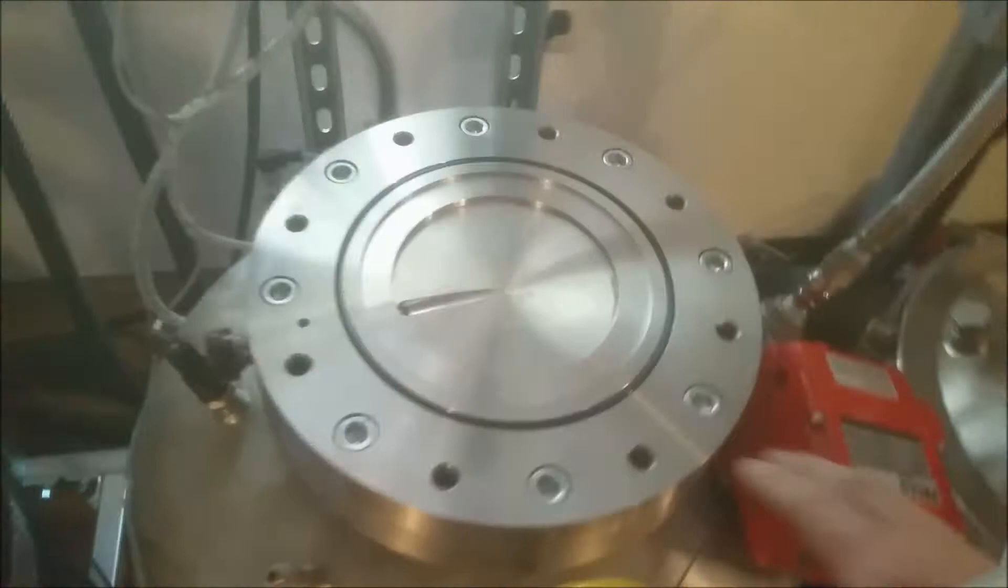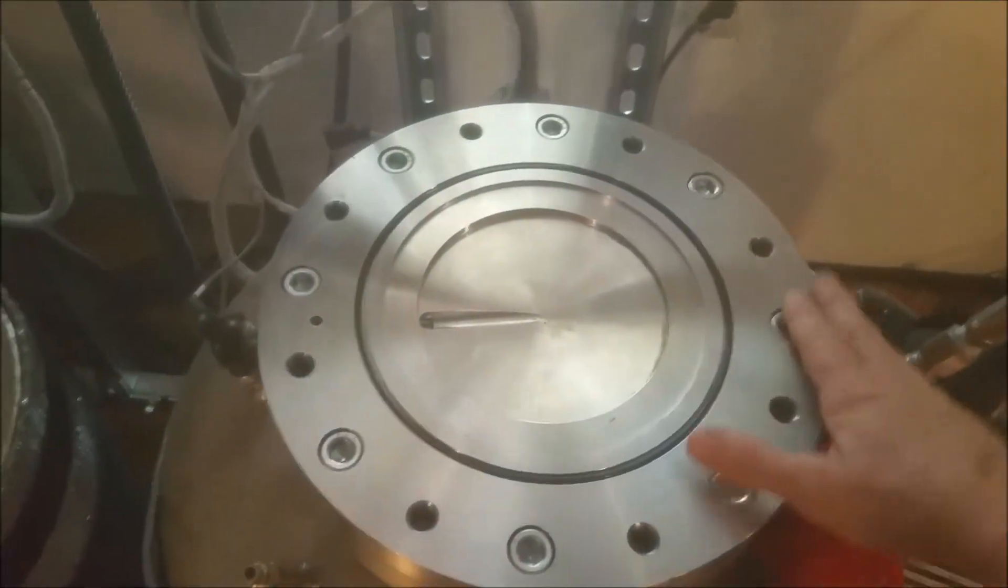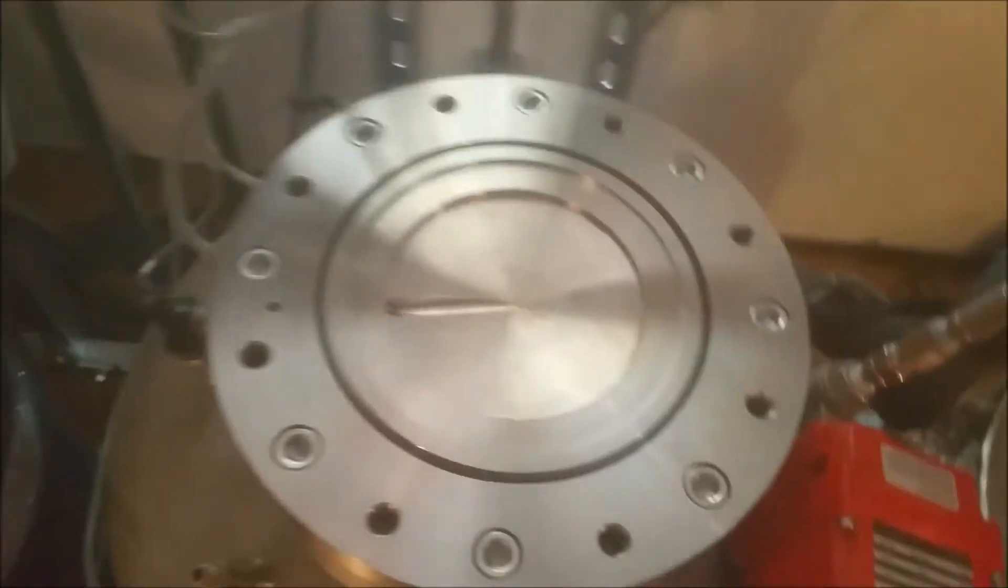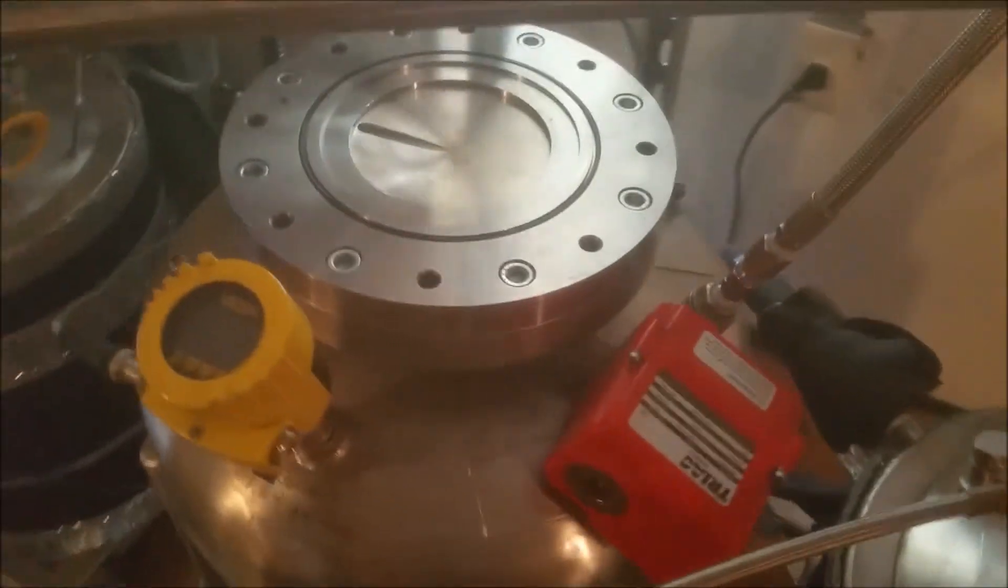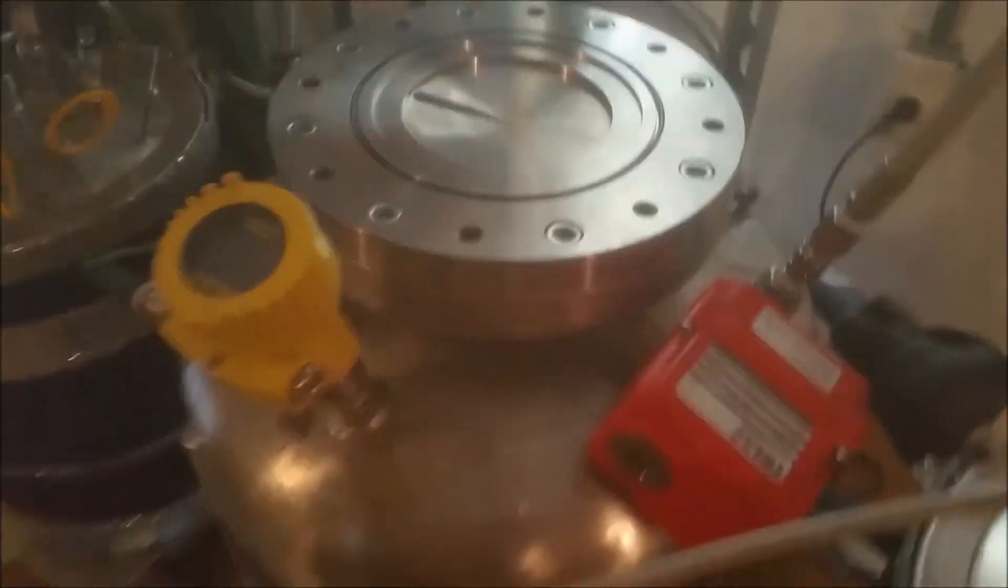So when we take the column off of the extractor tank or evaporator tank, there's a wafer valve that was created by me to give a low profile valve that seals this tank so that you can open it up.